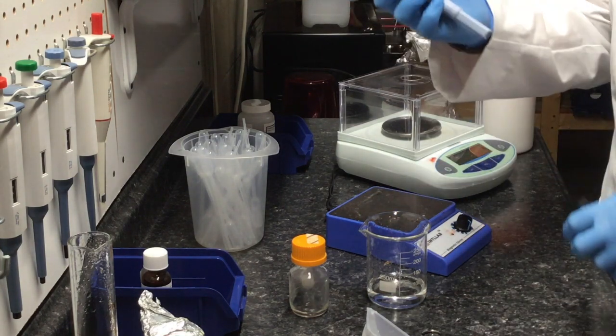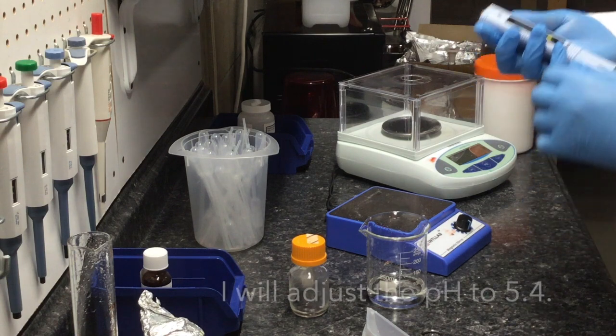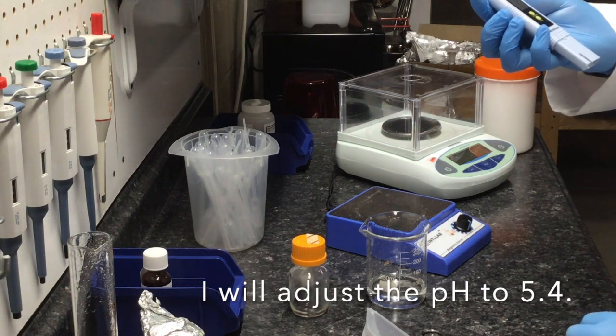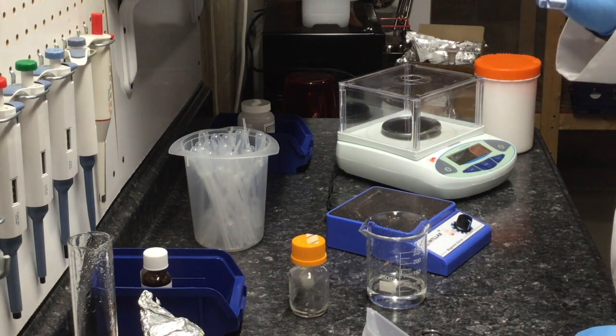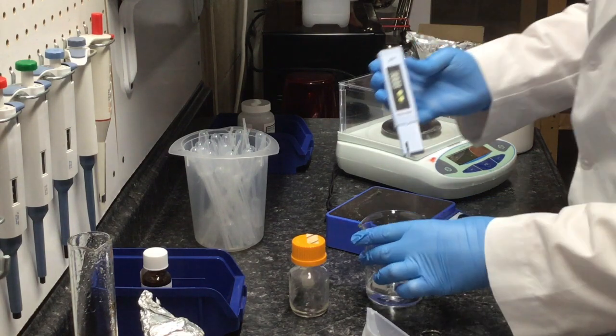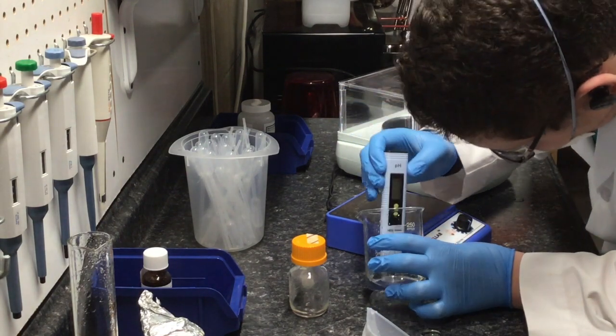I will now adjust the pH of the solution using hydrochloric acid to lower the pH or sodium hydroxide to raise the pH.